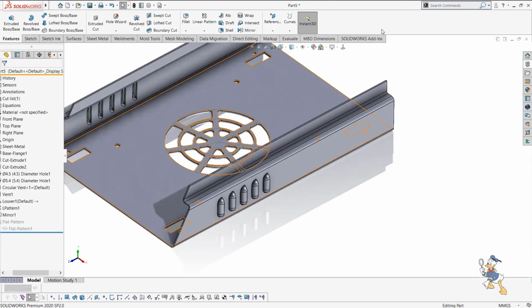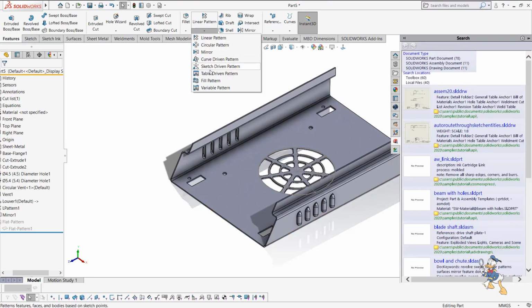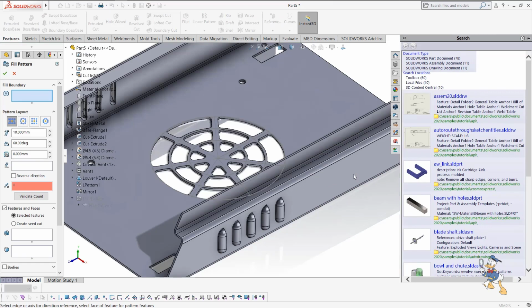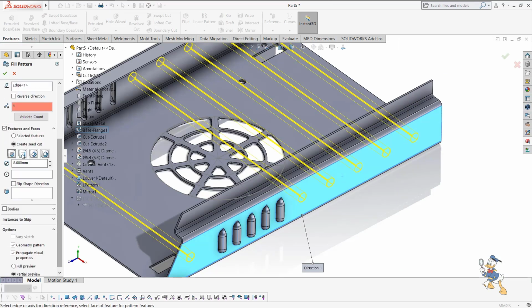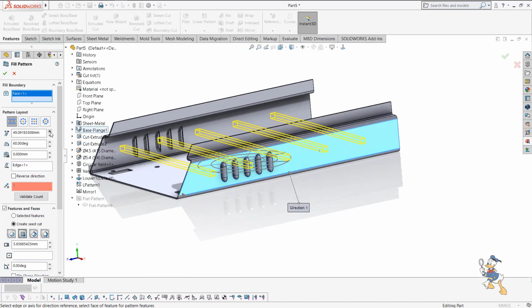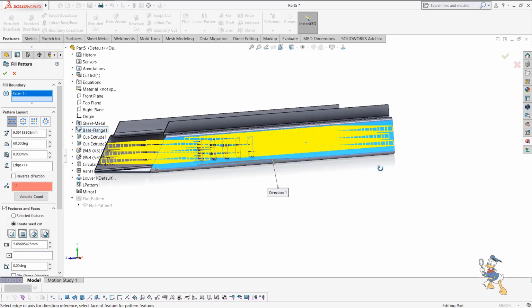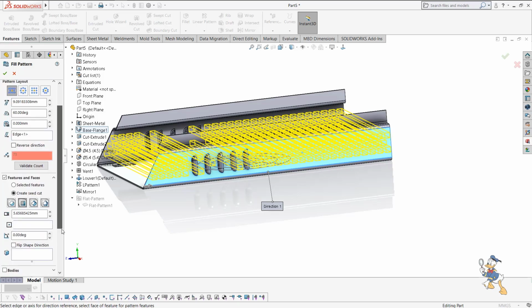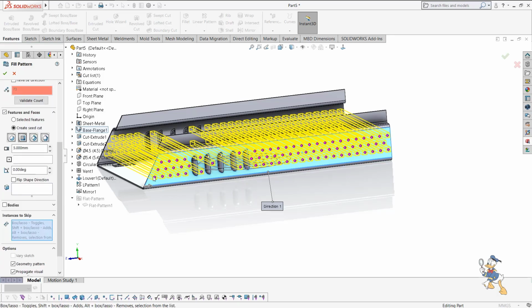There is one more good feature, which is the fill pattern. We can use fill pattern over here. Suppose creating the seed of the pattern, and how much pattern we need to have over here. We can have this much amount of pattern. Suppose we need to reduce the size of the pattern, we can set the size from here. And if we need to skip some instances as well, we can skip some instances like this.